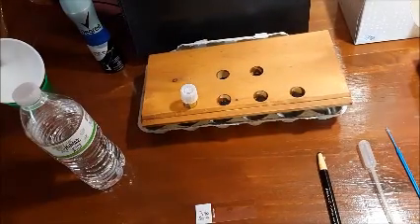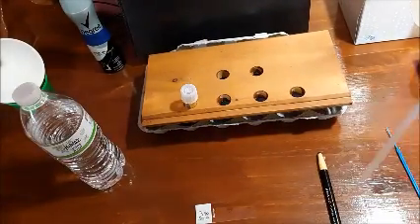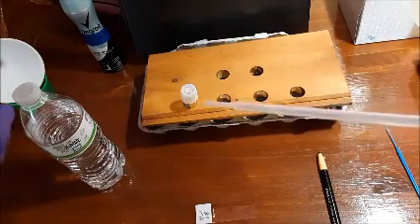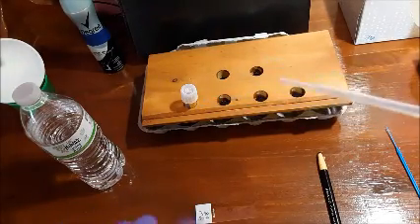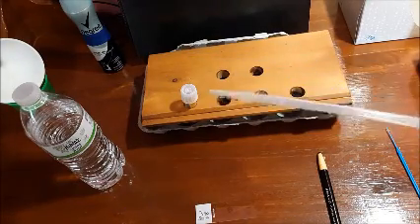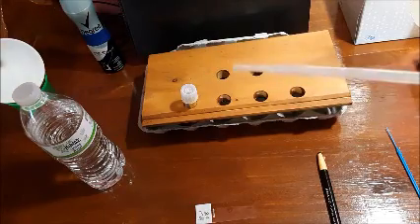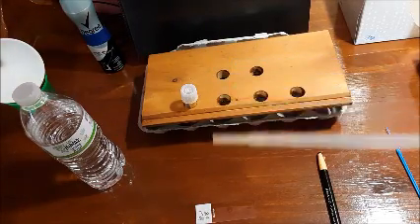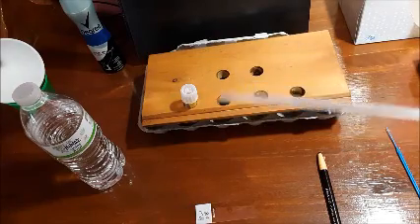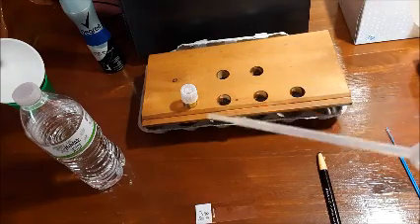So the first thing that you're going to do is you're going to use your plastic pipette dropper to transfer a small drop of water from this guy right here onto the slide down here. Now, in a real experiment, we'd be using a sterilized plastic pipette, or I wouldn't have it just laying around on the table. But because this isn't actually a real experiment, I can do it. But just remember, it needs to be sterile.